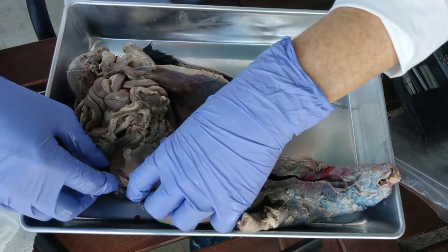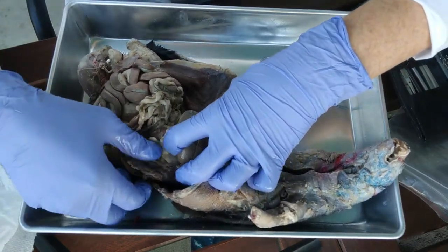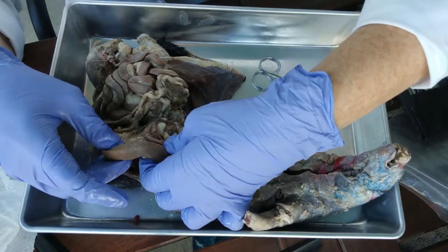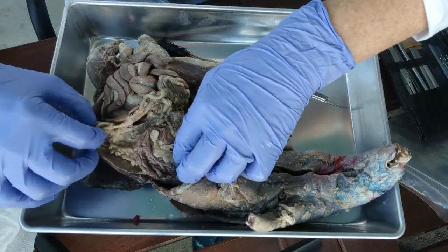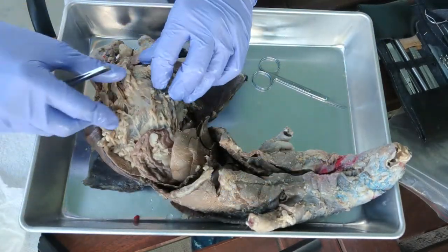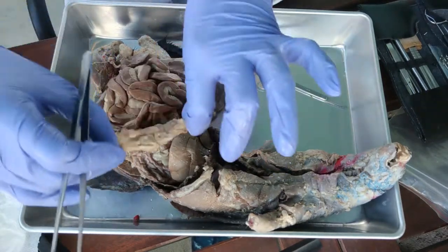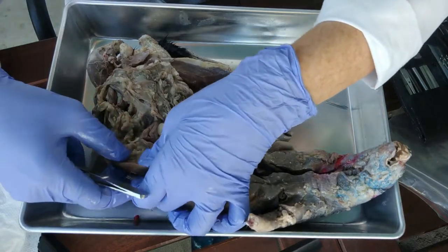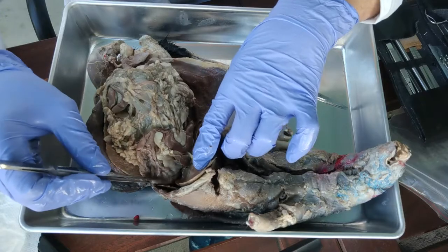Coming down, the liver takes up most of the space but is generally off to the right. Off to the left we have the stomach — a rather large stomach. Even further left is the spleen. Coming off the greater curvature of the stomach is the greater omentum, which generally covers your organs. Inside the greater omentum there's fat that acts as a shock absorber and protection for the organs. You also have blood vessels running through it, and connected on the very left side is the spleen — notice its distinct texture, very different from muscle.